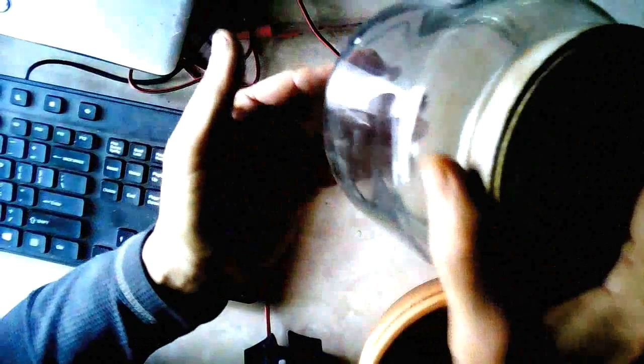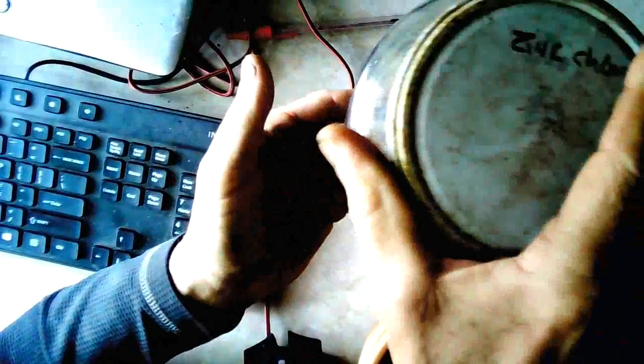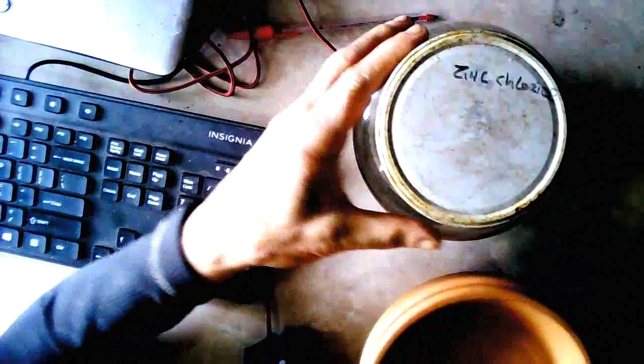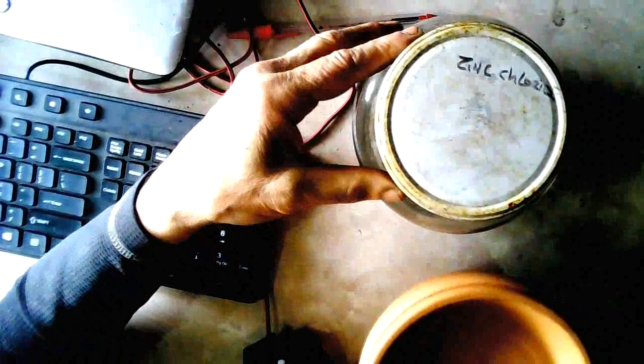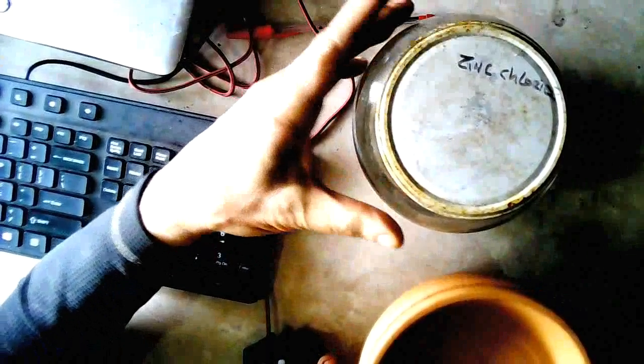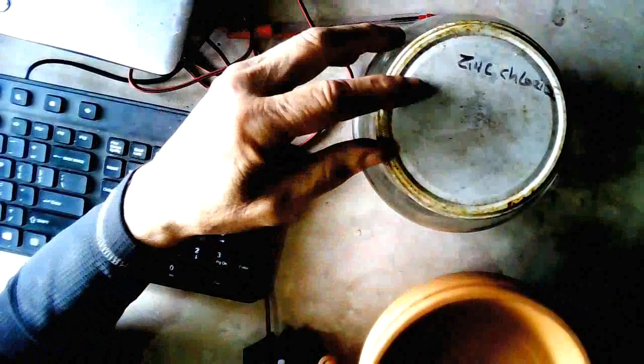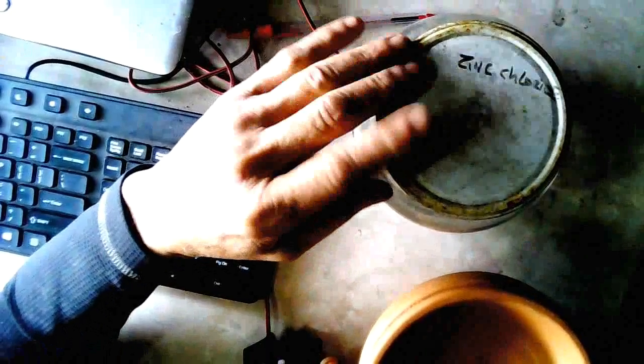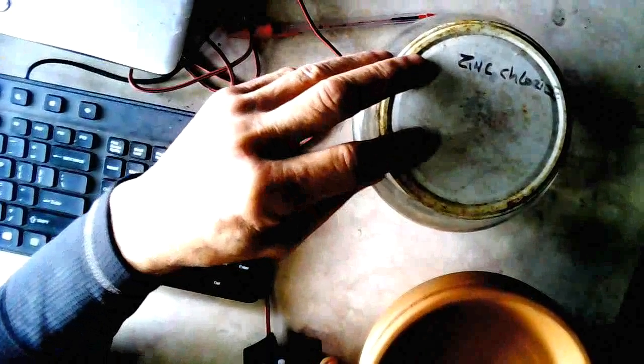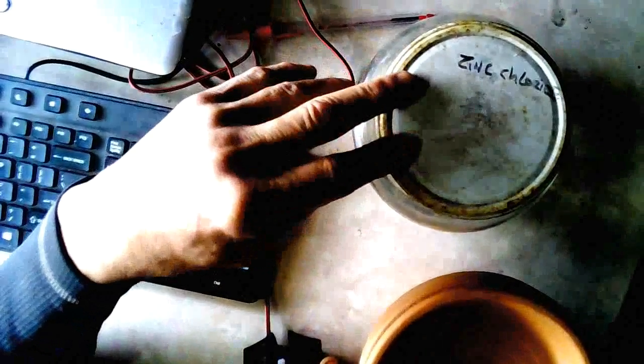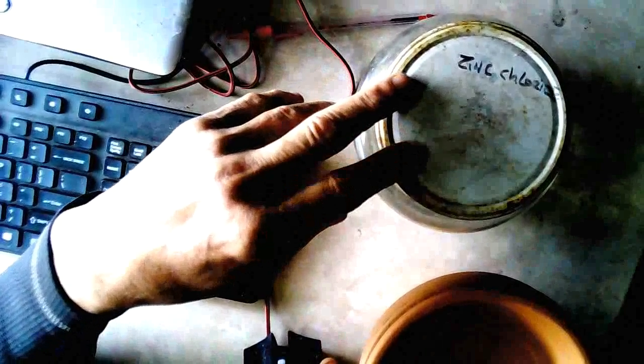I made this last year. It's about a jar, about a third full or so left. But you just take hydrochloric acid and the cheapest way to get hydrochloric acid is to go to the store and buy some muriatic acid which is about a 32% solution of hydrochloric acid in water.